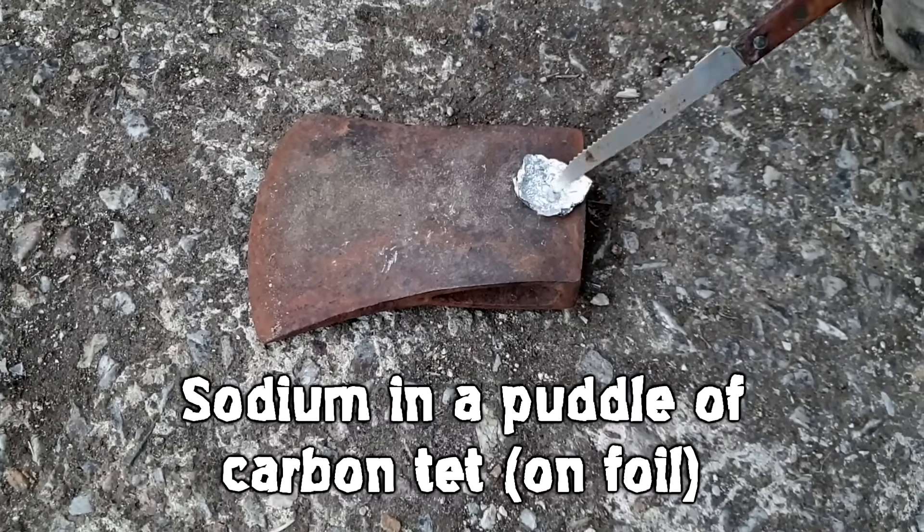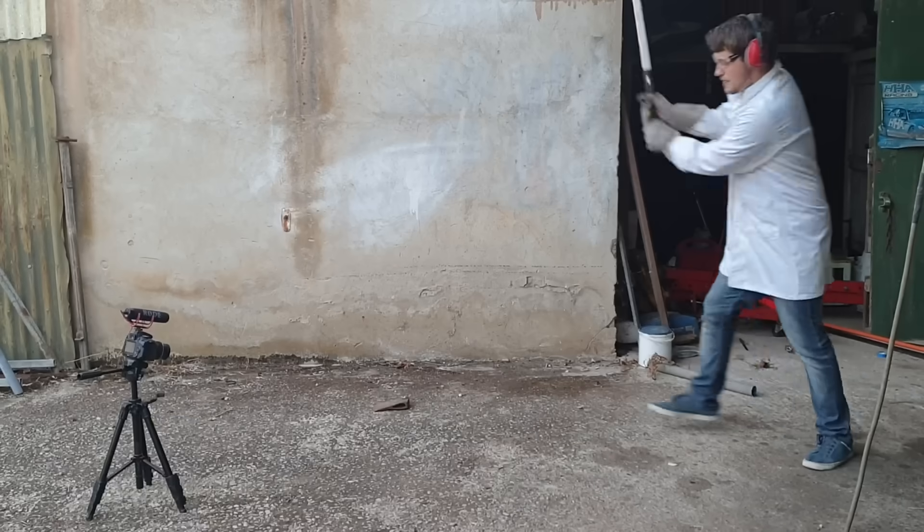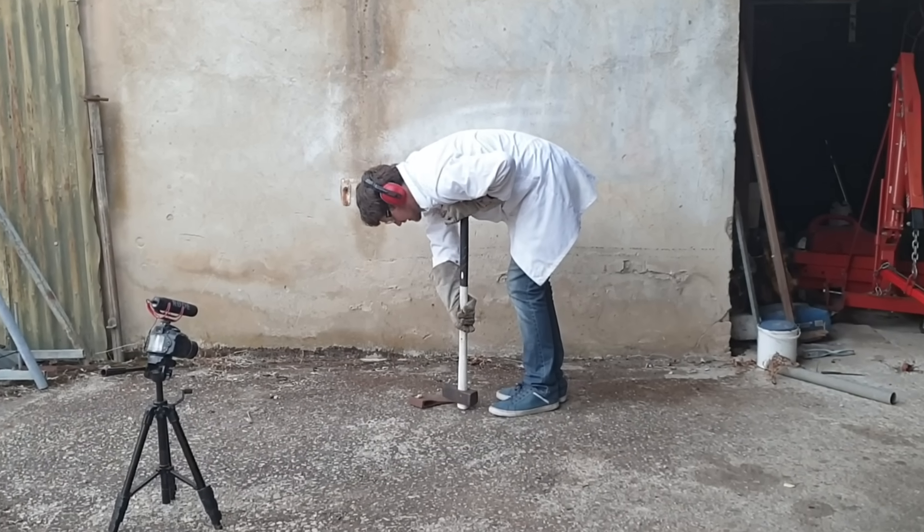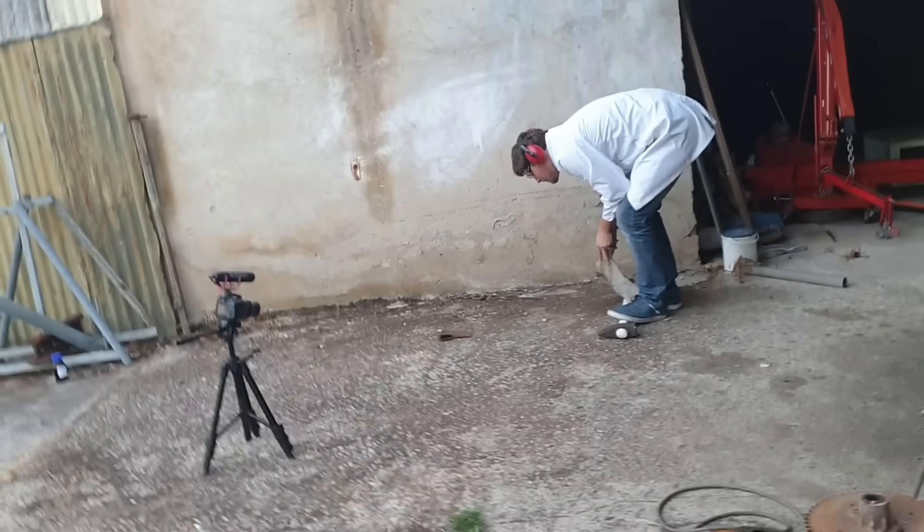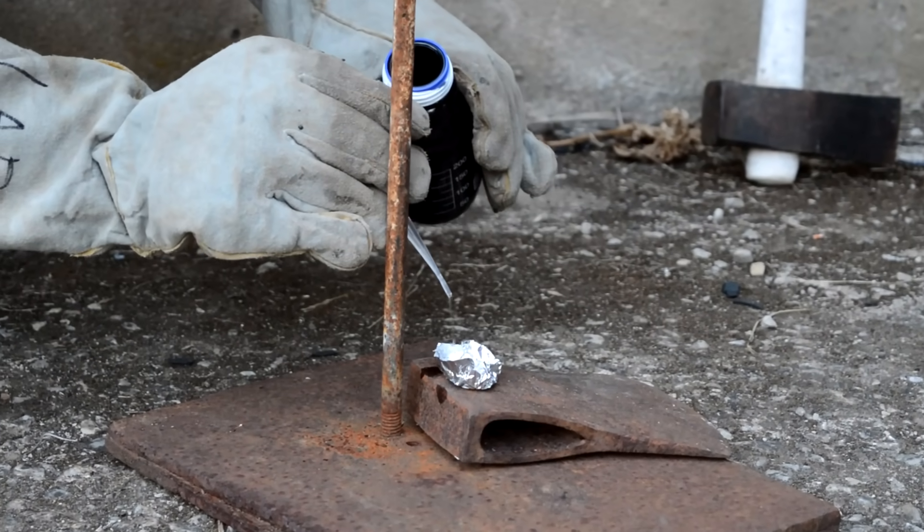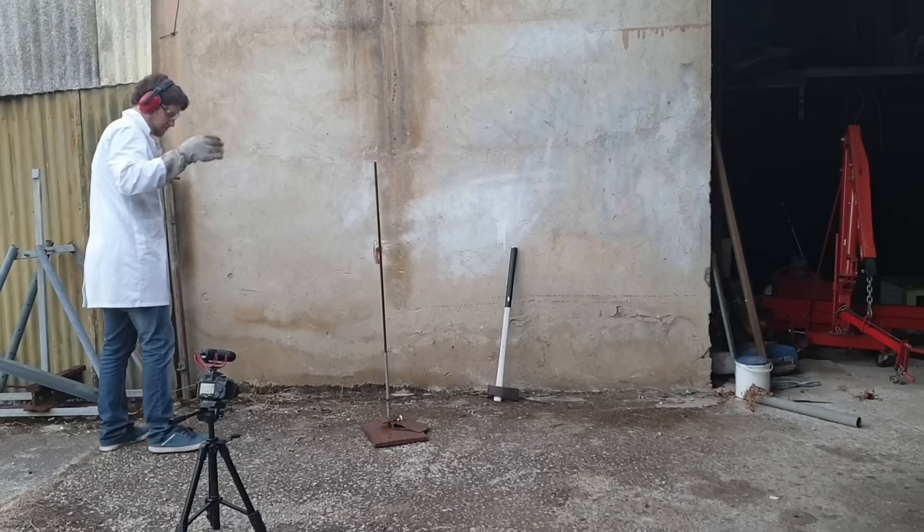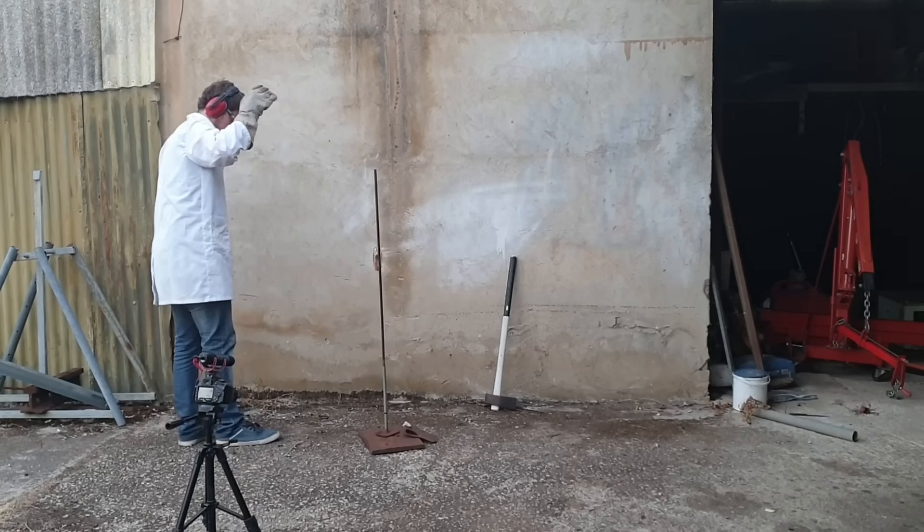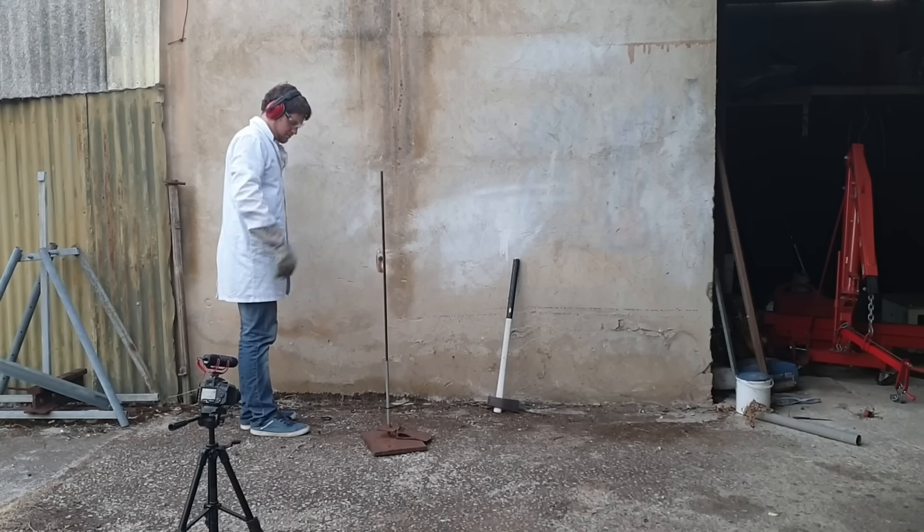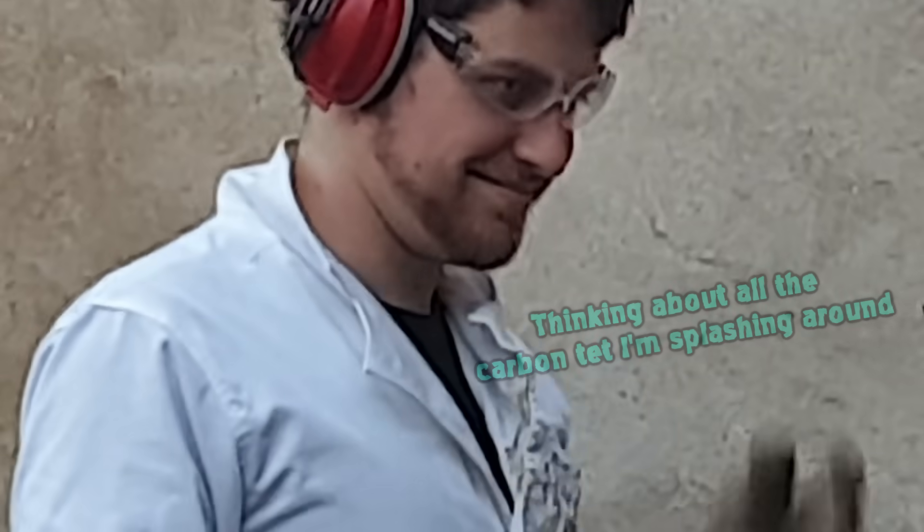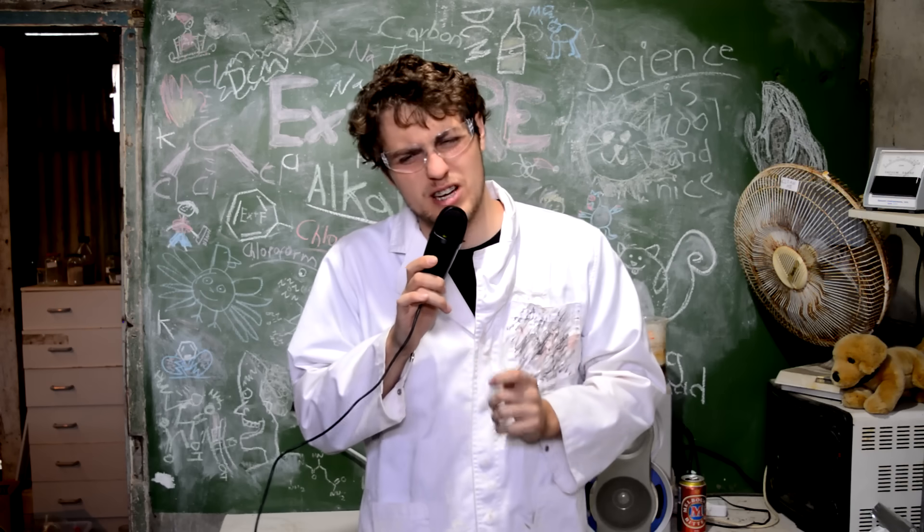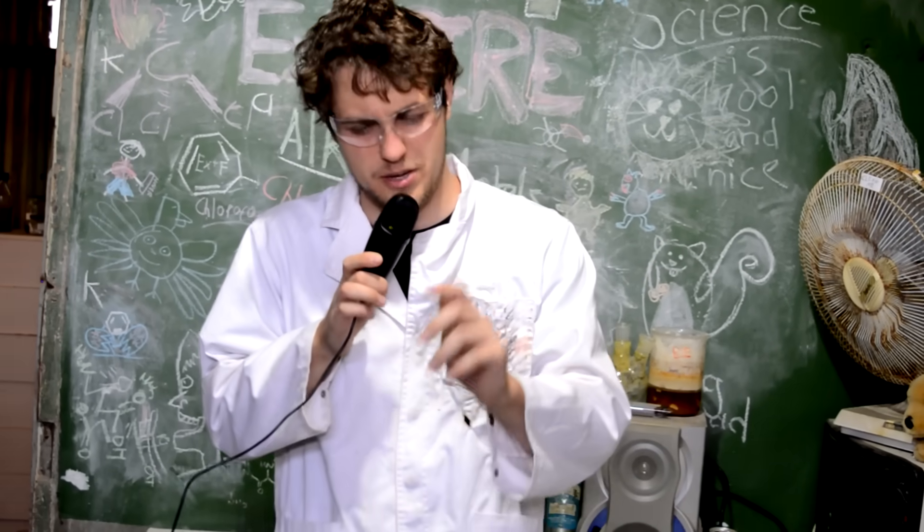Yep, it's fucking time to break out the hammer. You'd think after all these years of doing energetics testing, I'd be good at using a hammer. But I'm not. I don't know why. I'm just horrendous at hitting a tiny target with a giant hammer. So there's really no good explosions from this. Really, the carbon tetrachloride and the sodium weren't a really good mixture when I was hitting it with a hammer.